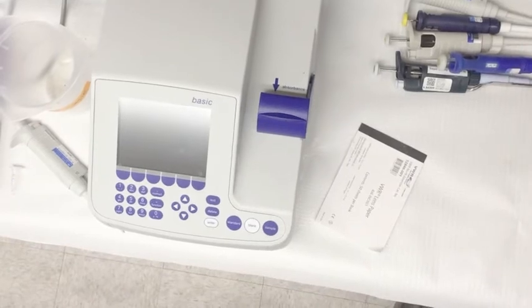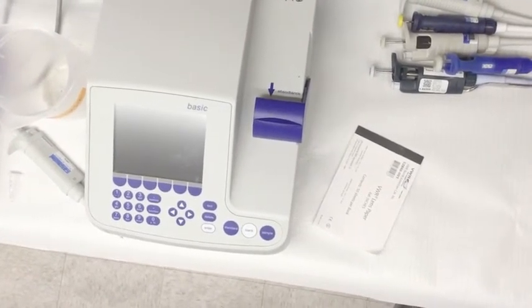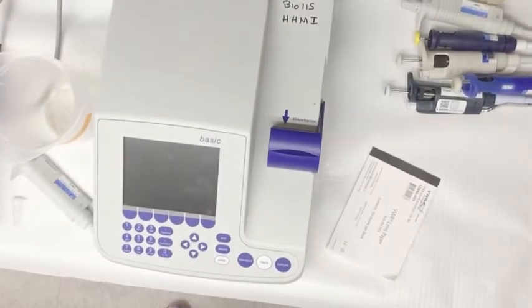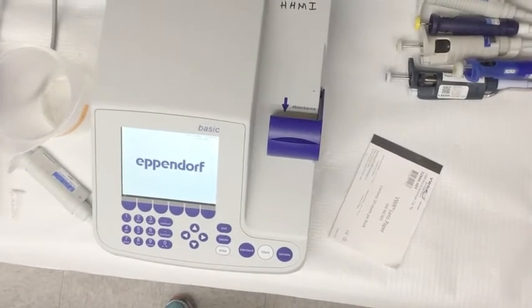In this video, we will review how to use a biospectrophotometer. To begin, turn on the machine in the back. Unlike the regular spectrophotometer, this machine does not need to warm up for 15 minutes.